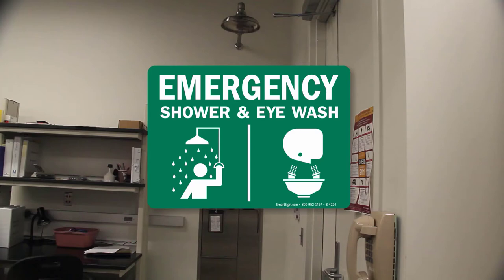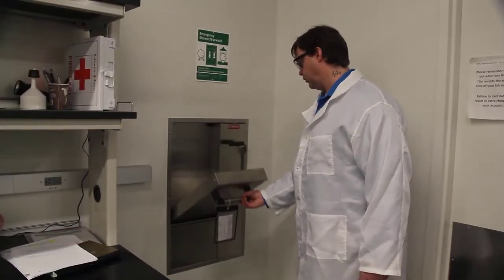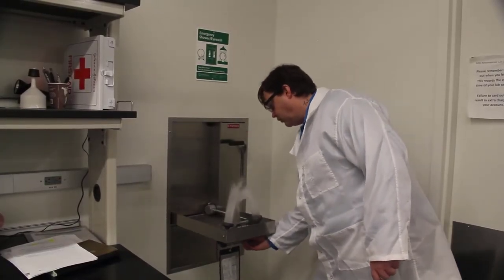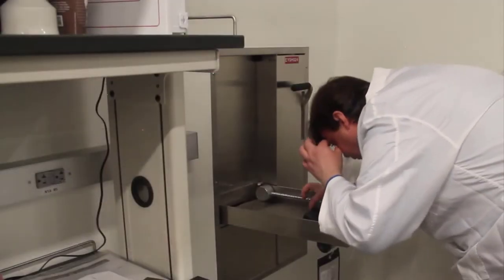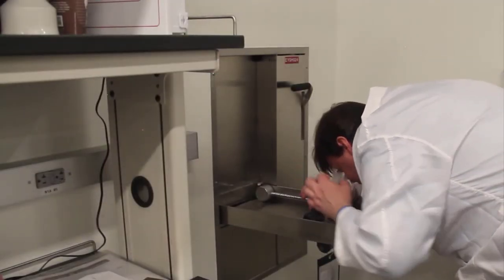Everybody should know the location of the emergency shower and eye wash in the lab. If any chemical is splashed into your eyes, immediately use the eye wash. Start the eye wash and let the water flow into your opened eyes.